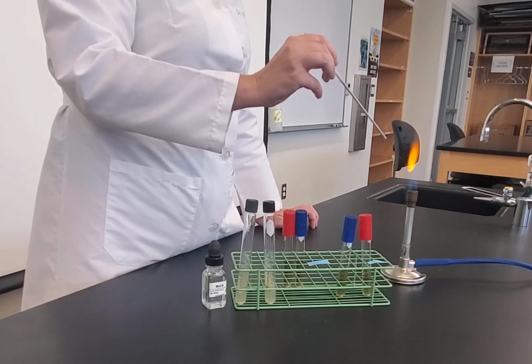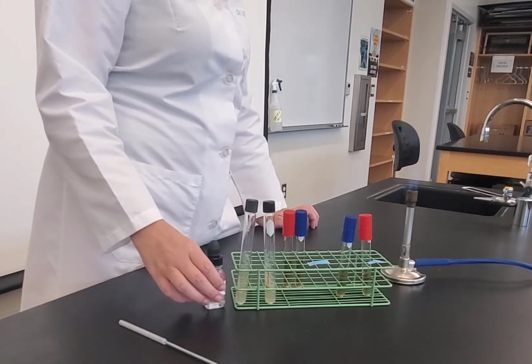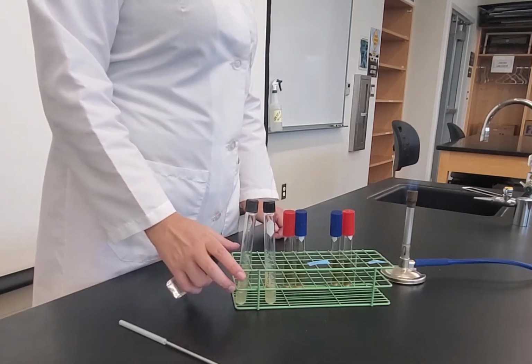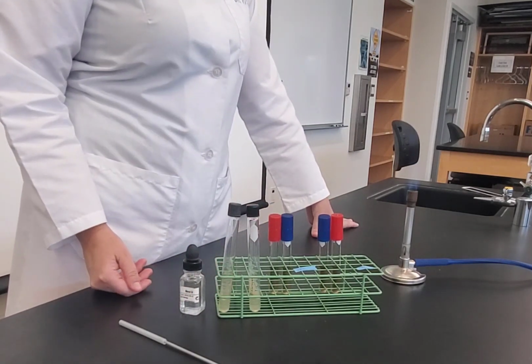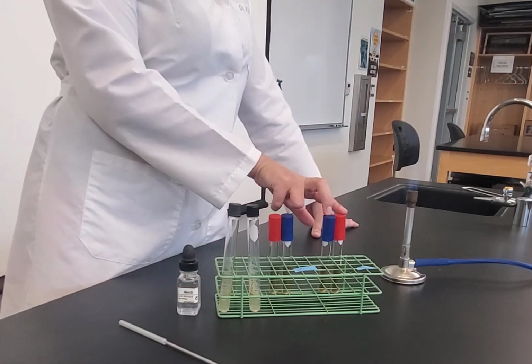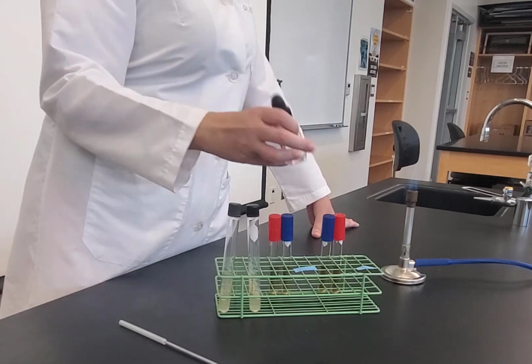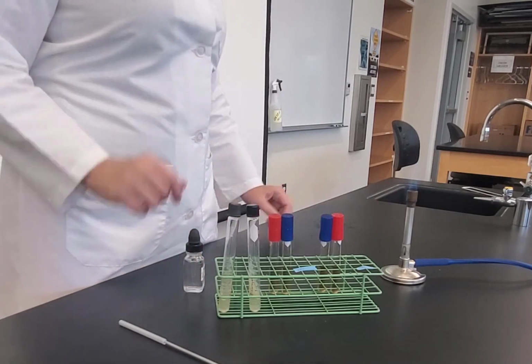And again, there was liquid on there, so I want to be sure to do that well. So I'm done with my loop. Now, this test is anaerobic. So just like when we did our OF test, how we had an aerobic tube and an anaerobic tube, this test is anaerobic, which means that we need to take these tubes that I've inoculated, and to make them anaerobic, I need to add mineral oil. So I'm going to add a layer of mineral oil to both tubes, just enough to seal out the oxygen.